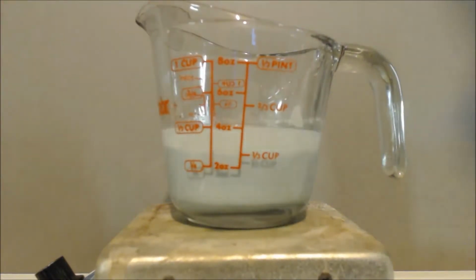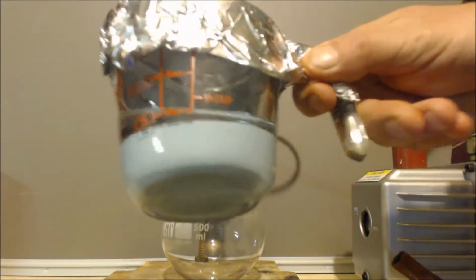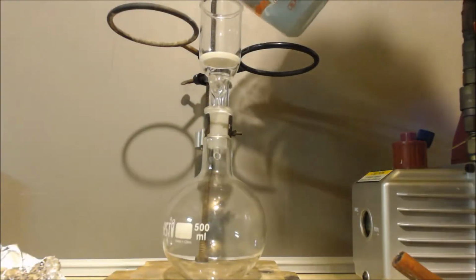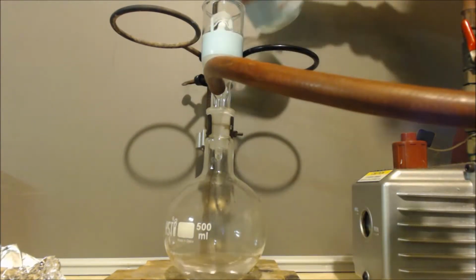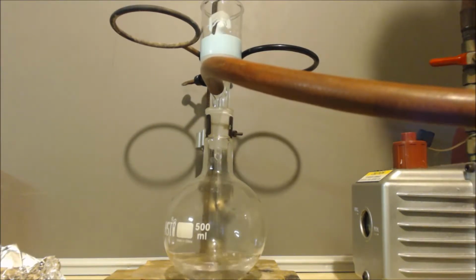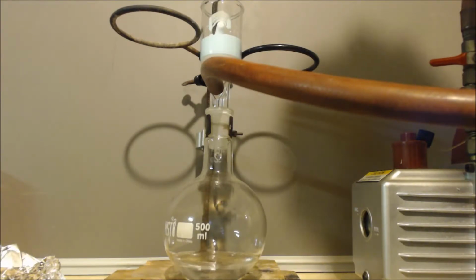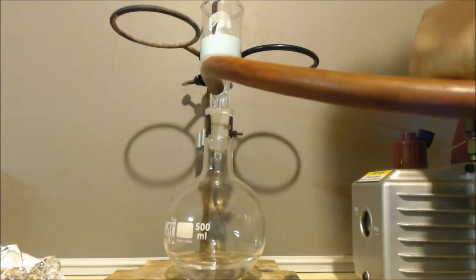We'll cover it up with cellophane on the top, and I'm going to let it spin. I'm going to let it stir for about 20 minutes. I gotta let that stir for like a couple hours, and I let it sit overnight. Time to filter it out. See how I turned the valve on, so I still keep my vacuum. I can turn the pump off, at least for a little bit. See, now it slows down. Then I'll have to open the valve, start it back up again, and get my vacuum again.